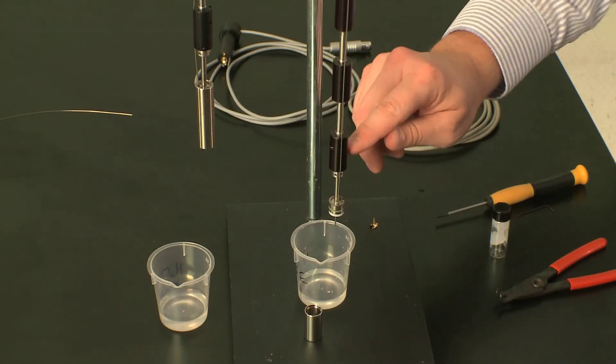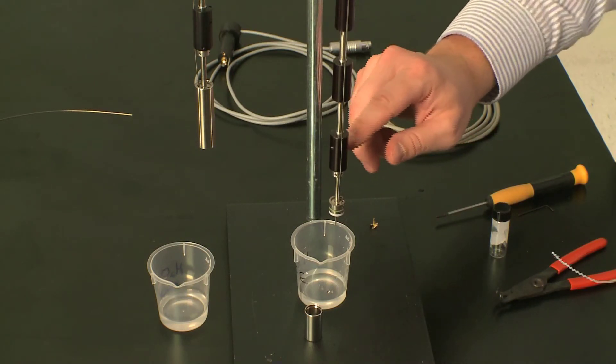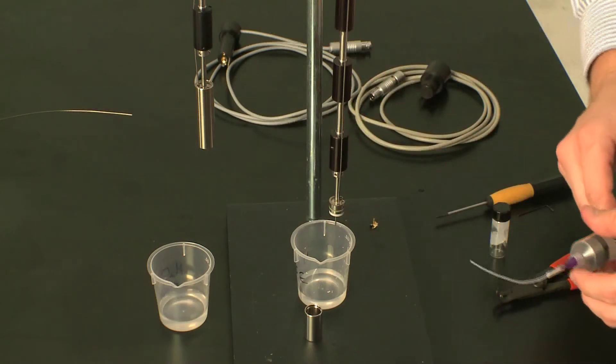This extracts any water droplets that you have on the lower end of the shaft. There is an O-ring and a Teflon separator right here where some droplets can accumulate, and we want to make sure that there's no droplets there.